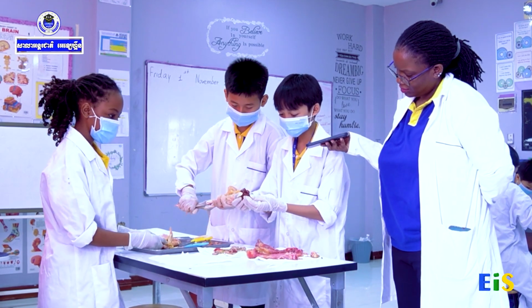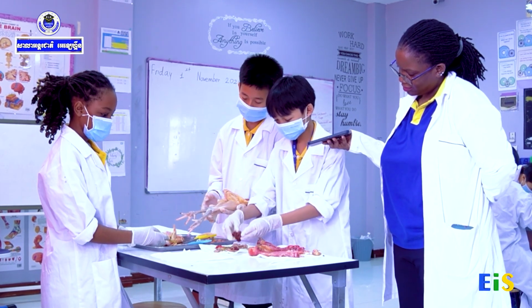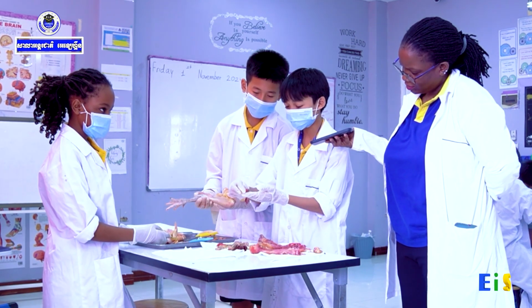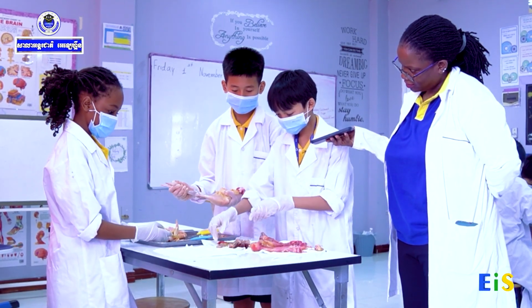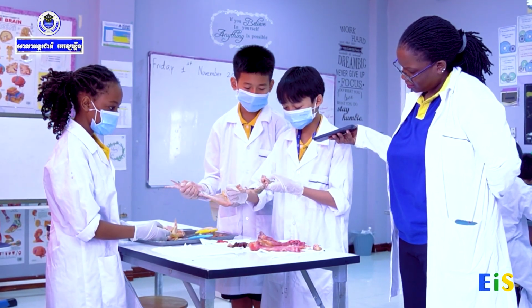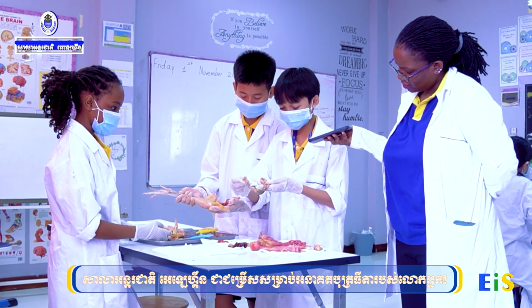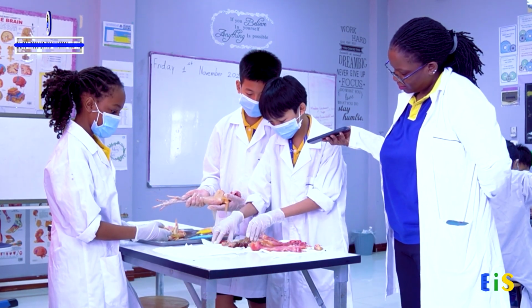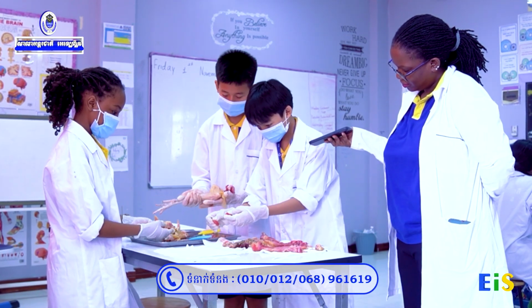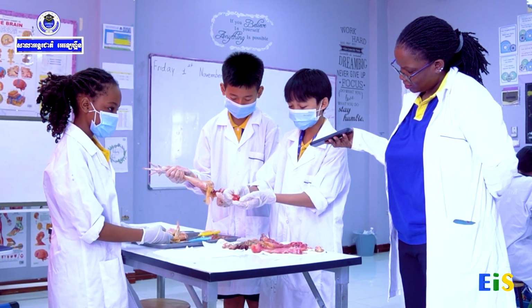This is the liver, and this is the gland. And this is the heart. The heart pumps blood throughout the whole chicken body. And this is the large intestine and the small intestine, as we can see. These are the lungs, which the chicken gets oxygen from.